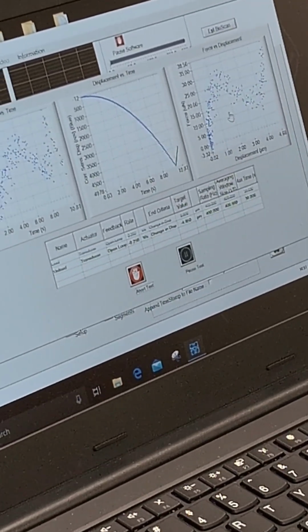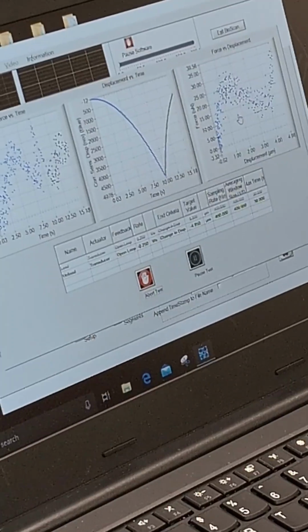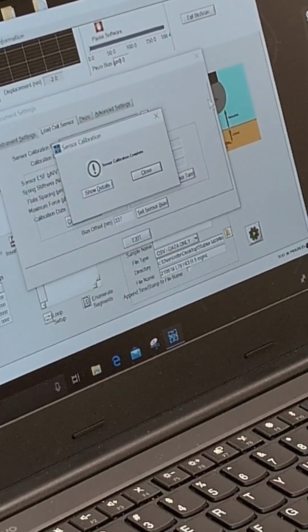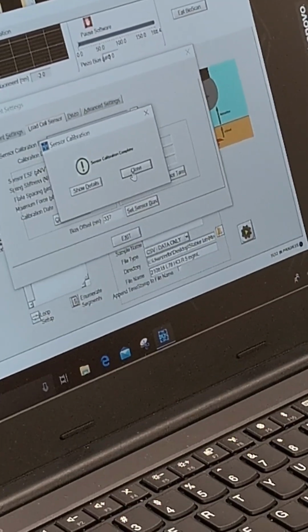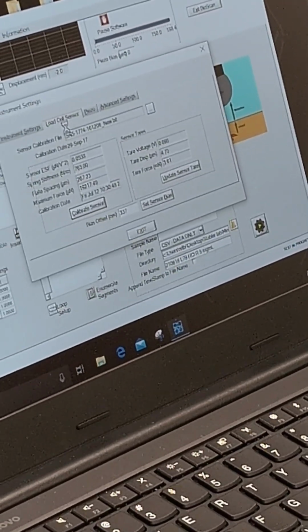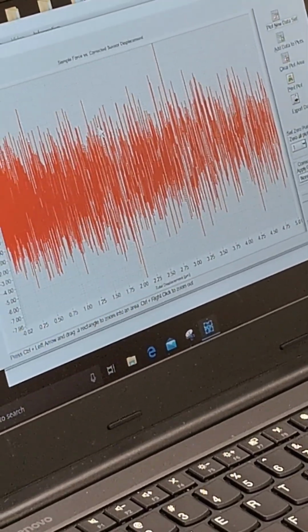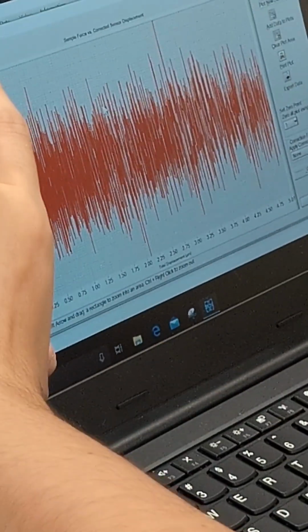More often, you may have to do 2 to 3 calibrations to get it into a correct range. All the calibration files will actually get saved. So in this case, I'm just going to close it to see what the final report is. Oh yeah, it's better. Good enough. So generally it's between positive 20 to negative 20.